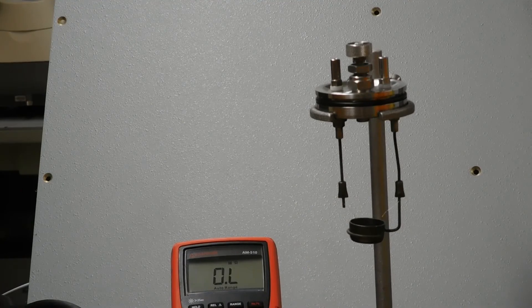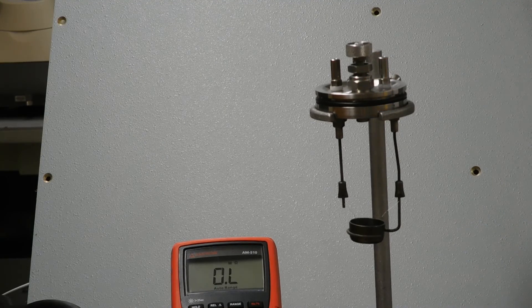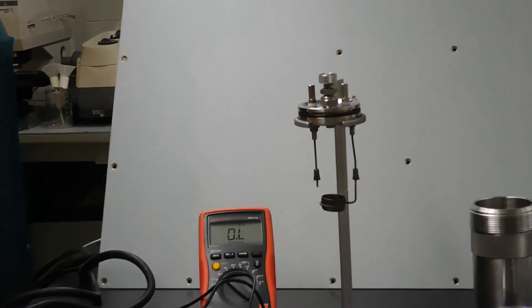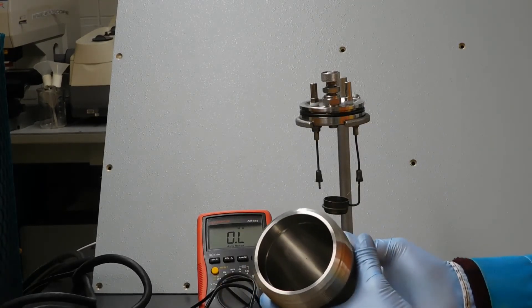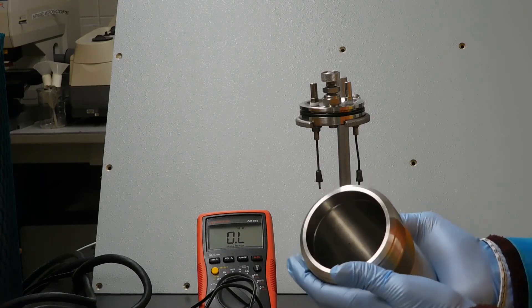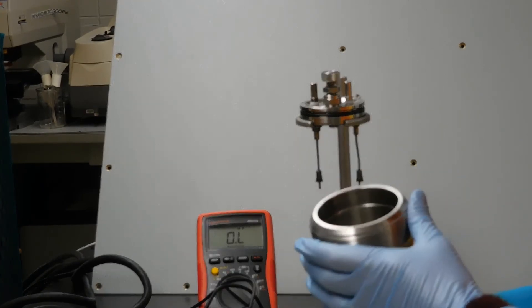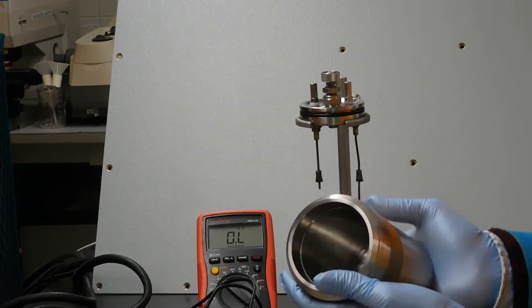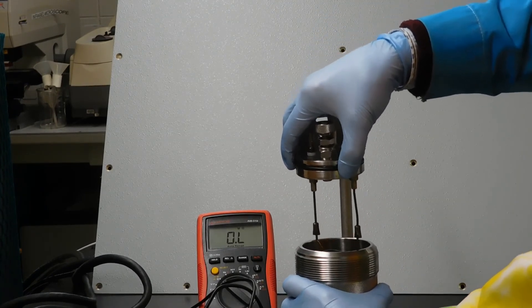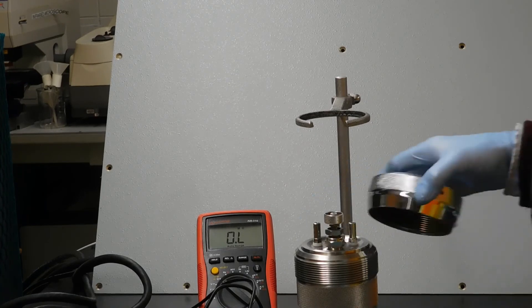Now you've got your assembly put together to go in the bomb, and you need to put it in the bomb. I'm going to back off just a little bit so you can see the bomb. This is the metal bomb. It's a big piece of stainless steel and they get checked because they're pressure vessels and they can break or rupture if they're not in good shape. Before you use it, make sure you clean out the inside. It should not have significant amounts of soot or anything like that in there. You load the bomb simply by putting this in and sliding it down until it seals. Then we have a screw top to hold it down.